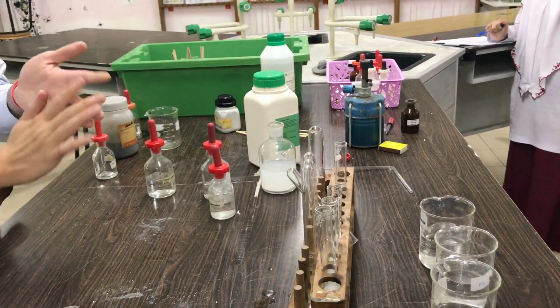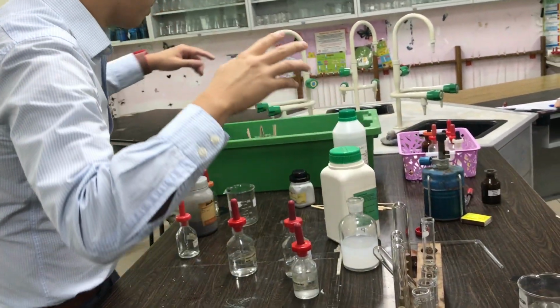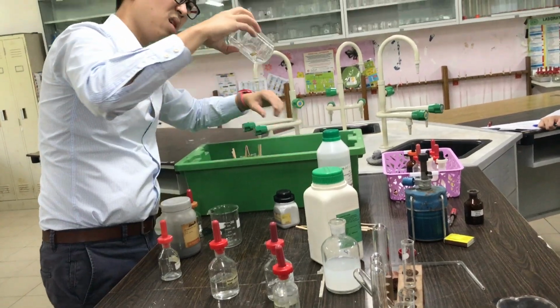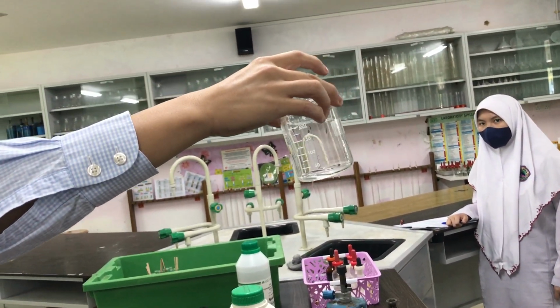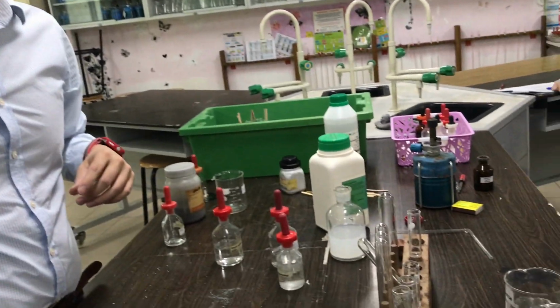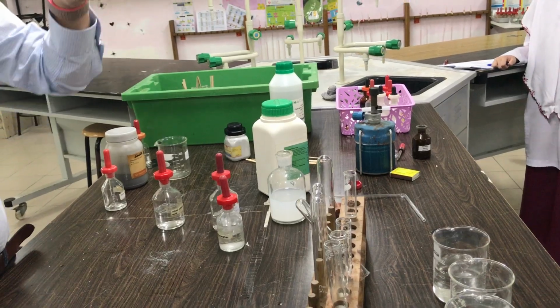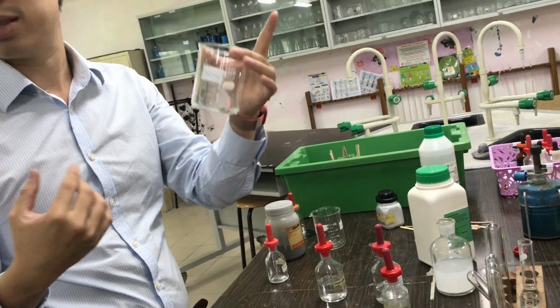What's the next test? Sulfate, that's the last one, right? Okay, sulfate. Let me try and find my sulfate. Okay, I'm left with very little sulfate. This is ammonium sulfate, NH4 plus from yesterday, NH4 plus, sulfate, SO4 2 minus. The crisscross, Year 9 chemical formula. Year 9 before the home-based learning.